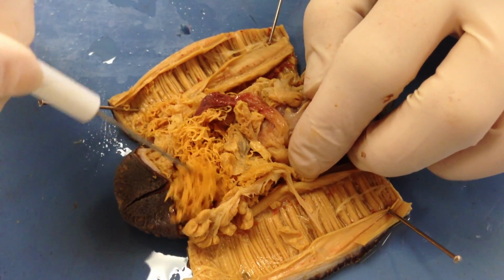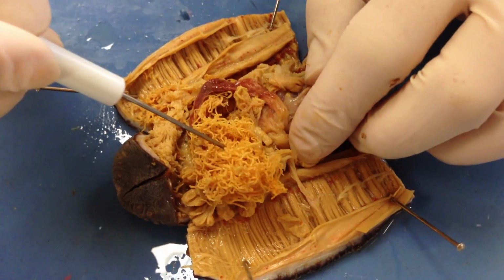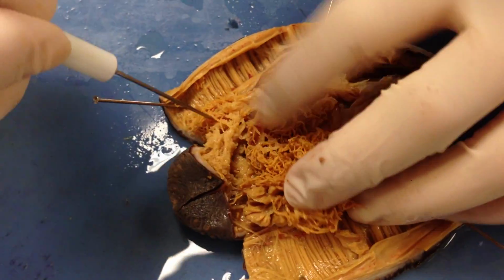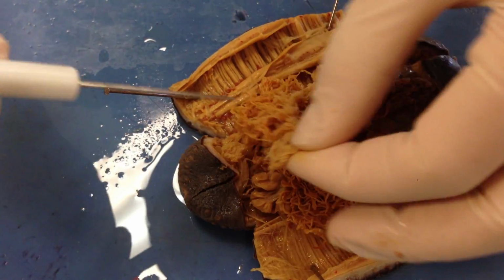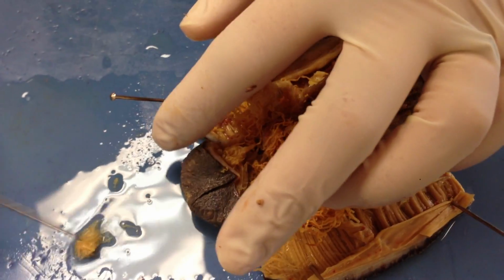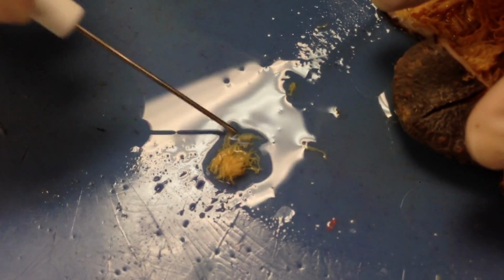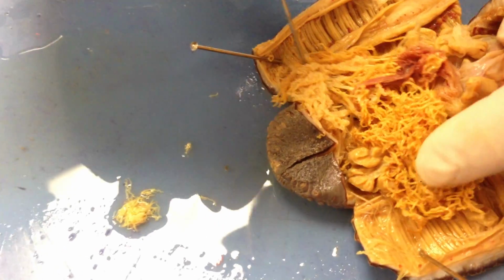The next thing is you have this set of chow mein-like structure, which is going to be the gonads. If we look over here, this is the respiratory tree, and if you take the respiratory tree and you remove some of it, it has a different color, but you can see in here all the little branches that come off of the respiratory tree to allow for more surface area and oxygen absorption.